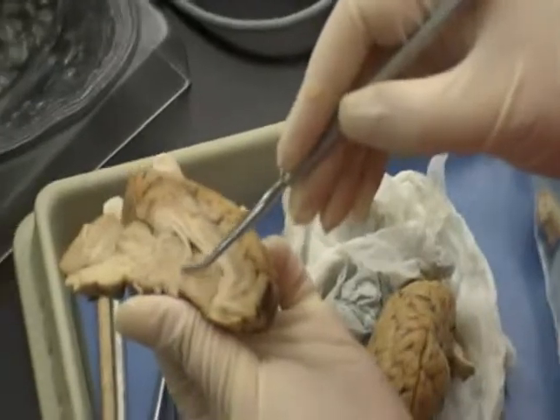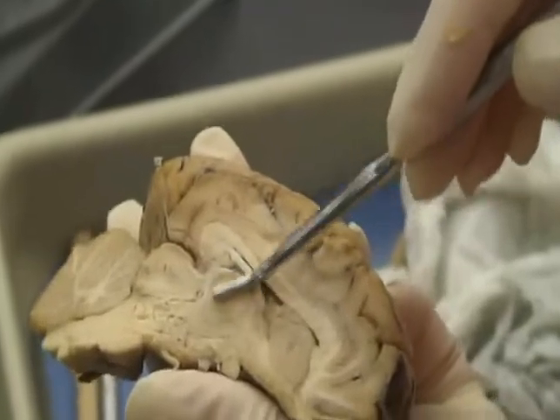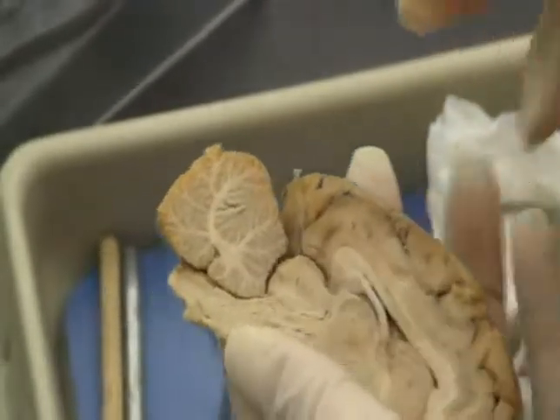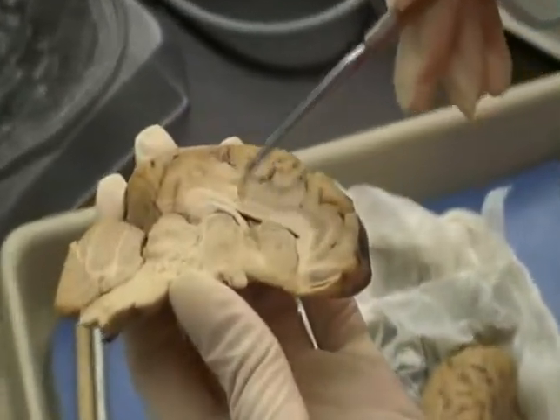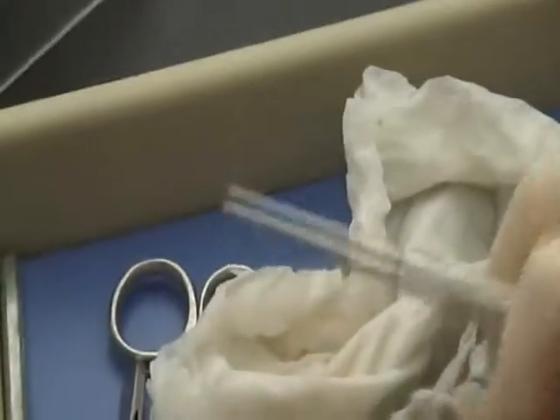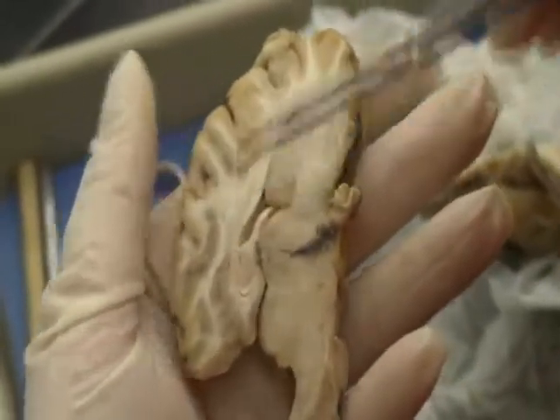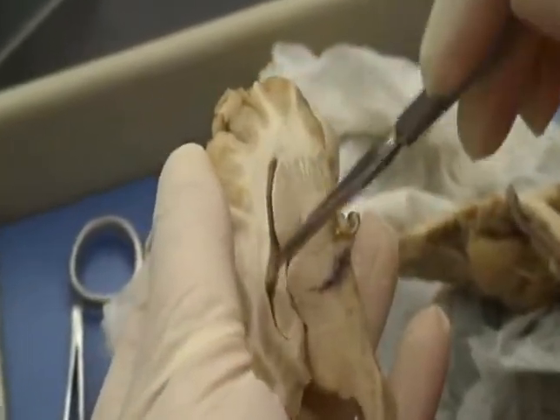Your hypothalamus is right here. It's kind of a gray matter area, just right here, right below the thalamus, which is right here. The arbor vitae, as I said, is found in the cerebellum. The olfactory bulbs and tracts. The cingulate gyrus, again, part of the limbic system. It's the first gyrus above the corpus callosum. The hippocampus. Again, you can only see that if you cut a parasagittal section. Mammillary bodies, left and right lateral ventricles, again, left and right lateral.